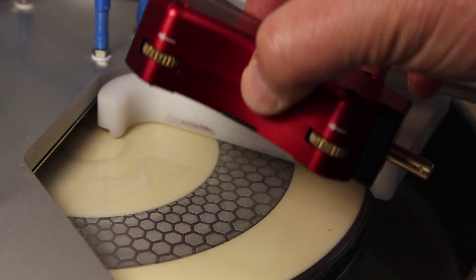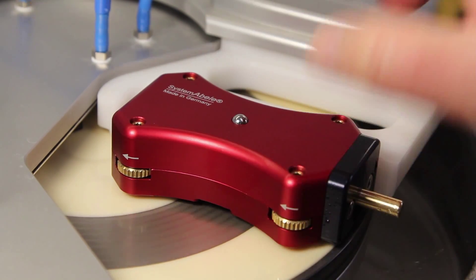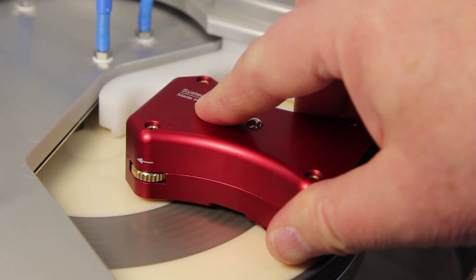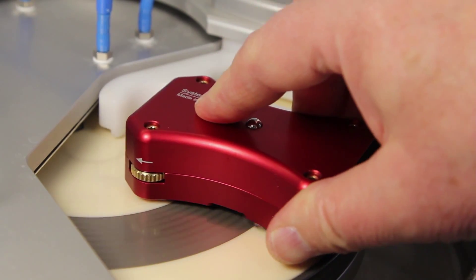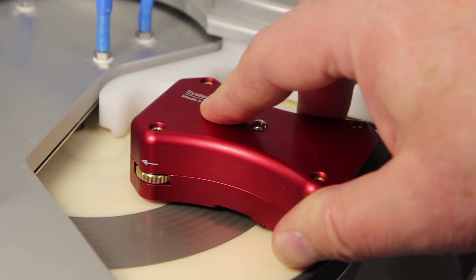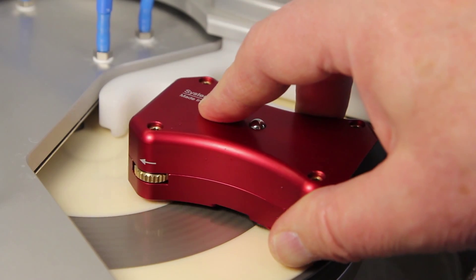And now I grind more carefully. I don't press down. It's ready now.